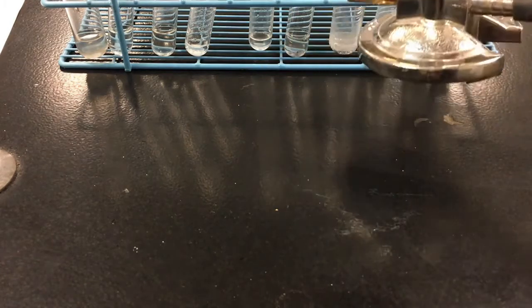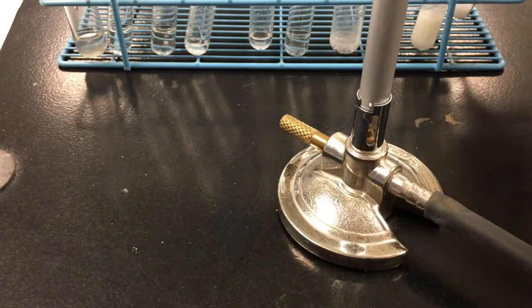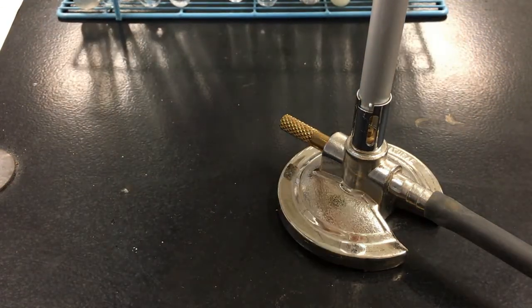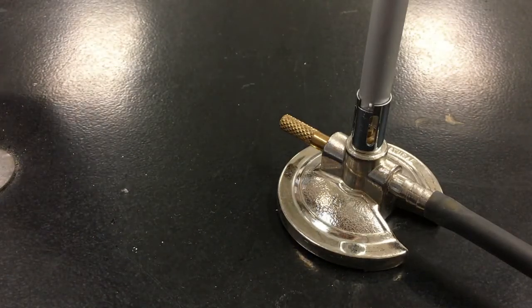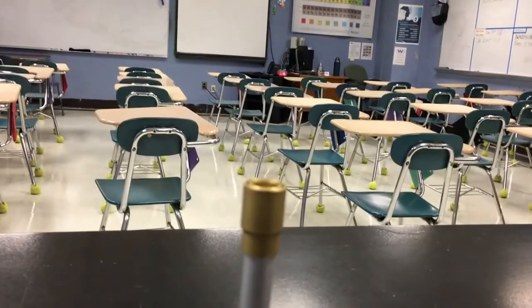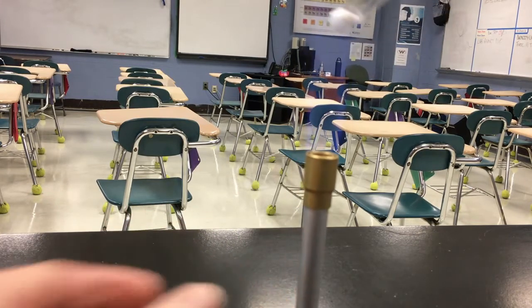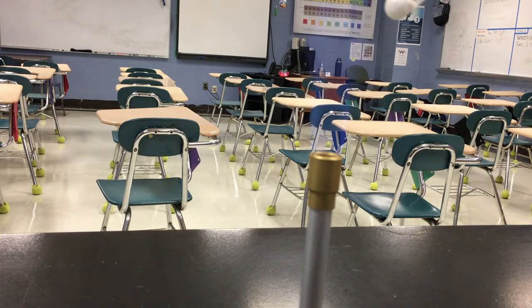For the last reaction, we are using solid C with heat. So there's no liquid in this test tube at all. We just have heat. And I've already put solid C in the test tube. I'm going to move the test tube rack out of the way so that the area around the Bunsen burner is not cluttered. And I'll pan up a little bit so that you can see better what's happening in the test tube. So I'm just going to gently heat solid C. In fact, I'm going to make this flame a little less hot, just so it's a little bit more of a gentle heating instead of a harsh heating.